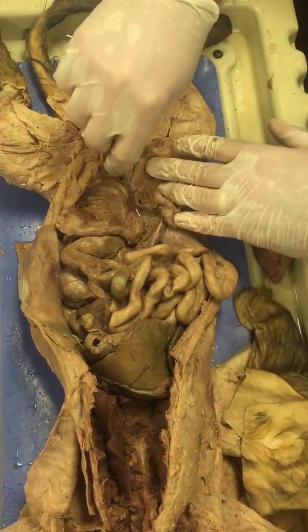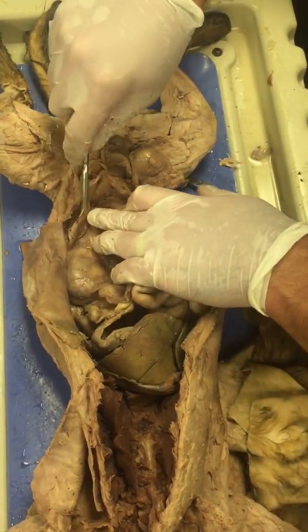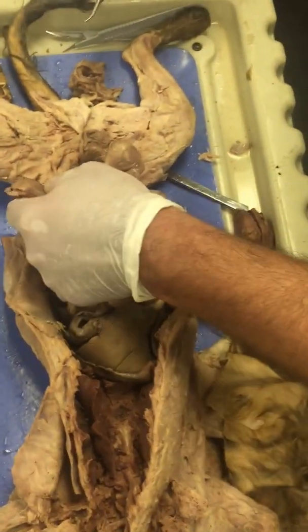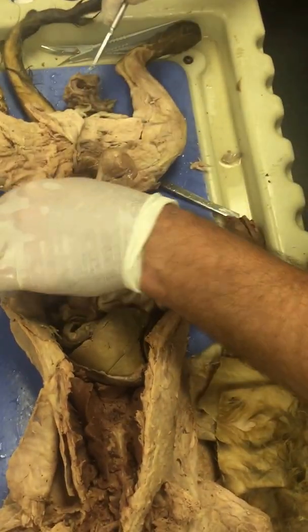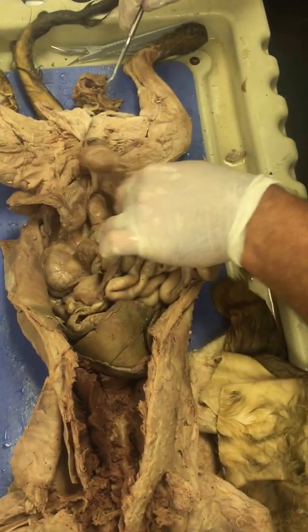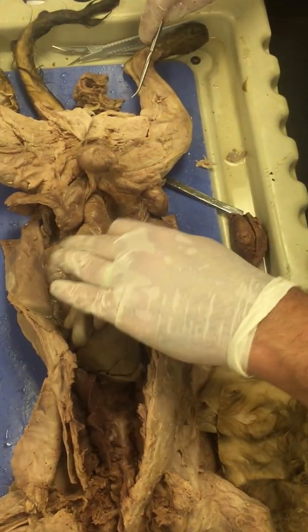If you follow the fallopian tubes up, you can find the ovary right here. Here's the ovary. Okay, so release of eggs, multiple eggs typically in cats. If fertilization occurs, implantation. And so it looks like 1, 2, 3, it would have had a litter of 4 if it had come to term.